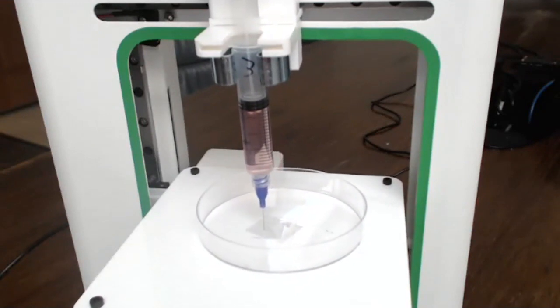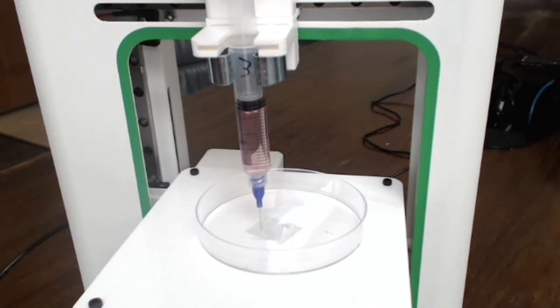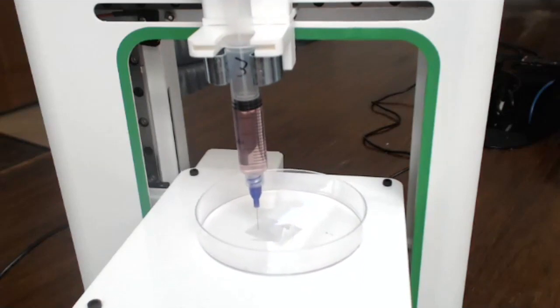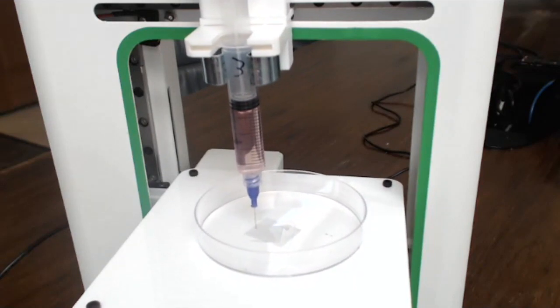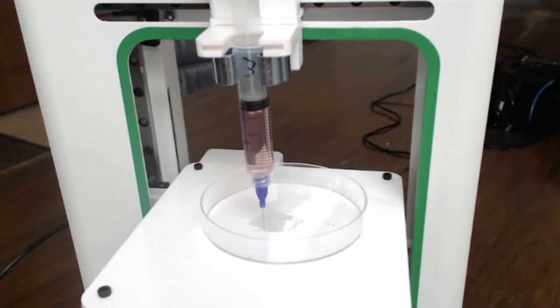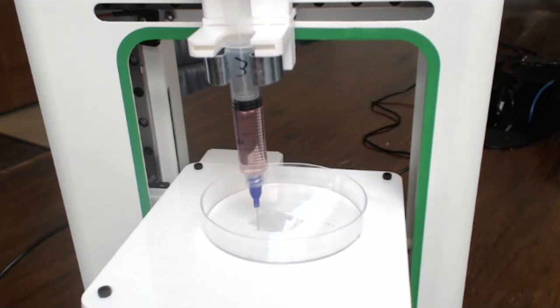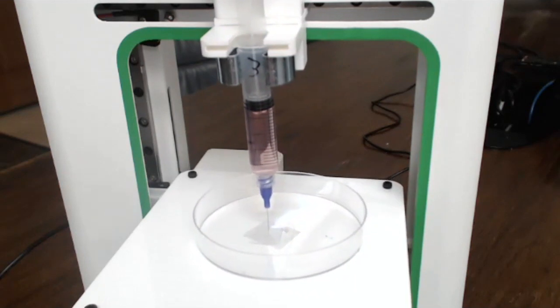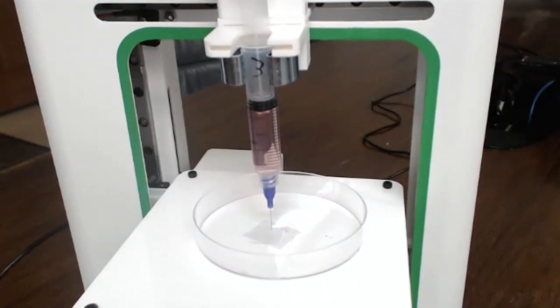So there is a question about FRESH. And yes, FRESH printing is a bit different because the idea of FRESH is that you're printing in a slurry of gelatin, right? And the slurry serves as almost a support material. It's great for printing things like collagen because collagen has very low viscosity. If you print collagen on its own without any support material, it's not going to hold its structure very well at all. So the idea of FRESH is that you could use the slurry as a support material and be able to print some really intricate structures using this soft material such as collagen.